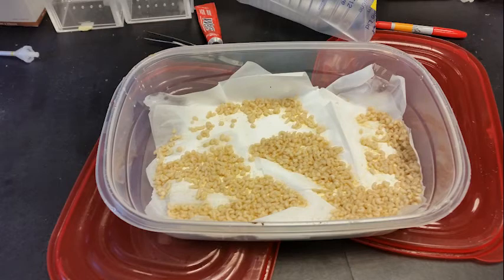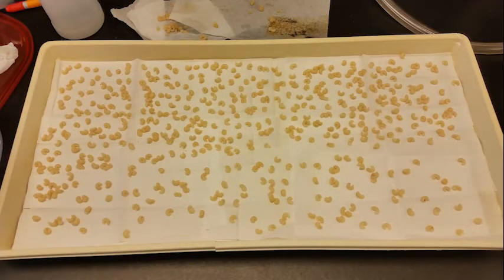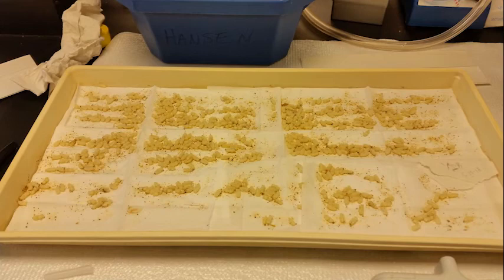And so we can use this as our starting material and take all these larvae without having to do very much work. After they all crawl out, we simply just sort them out onto a tray like this so that they're not touching each other. So it's easier for us to count them and clean them. We do remove any that are really sick looking. We then put them back in an incubator where they can then mature.